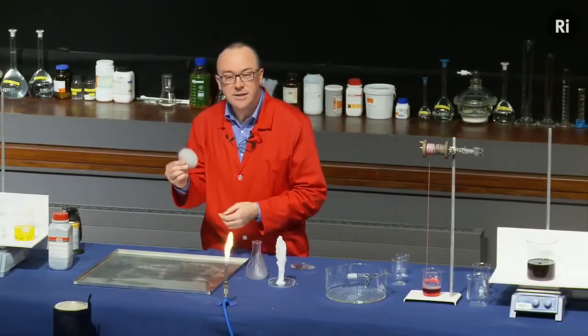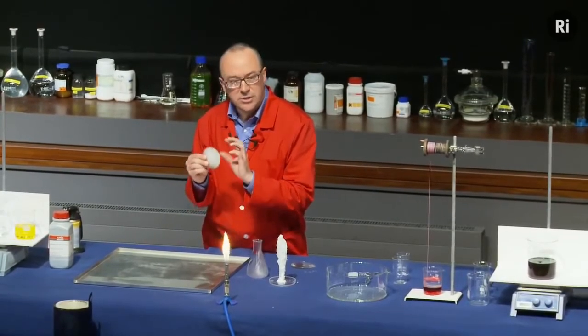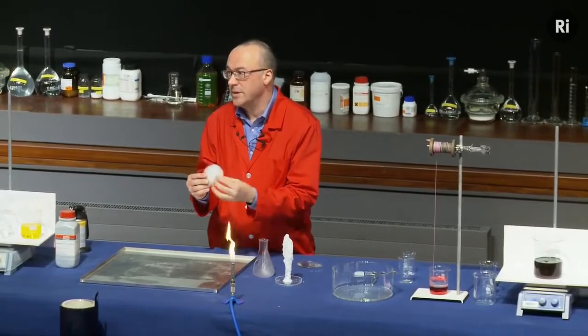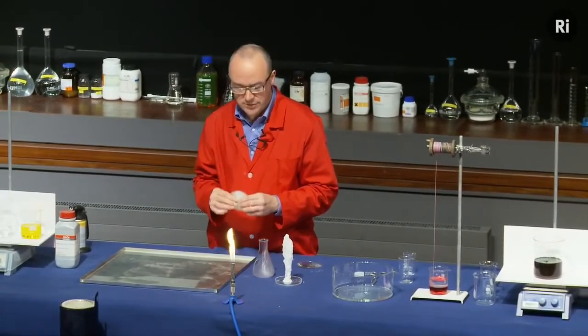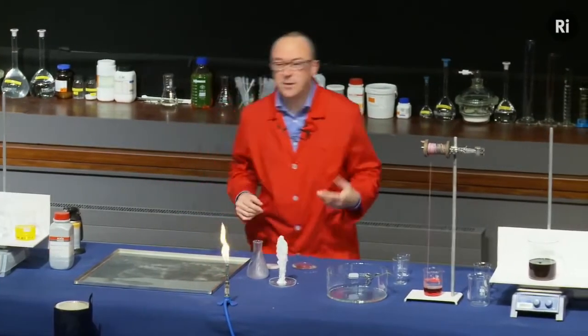And then I can take this and put it into boiling water for a couple of minutes. The crystals will turn back into a liquid. I can allow it to cool, and they'll stay as a liquid, and it'll stay like that for weeks or months until I'm ready to use it again. I can use it thousands of times. Okay, so that's sodium acetate, a sort of chemical sculpture.